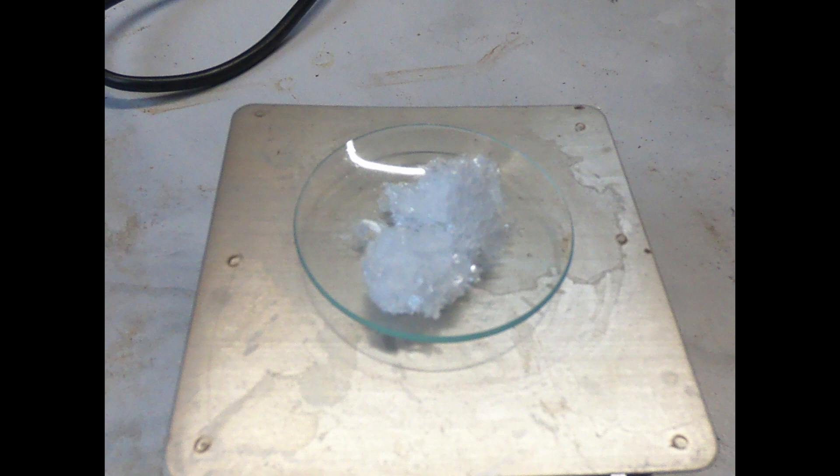Here I've placed some of my nice pure sodium carbonate crystals on the watch glass, and as you can see they're nicely formed and quite large.